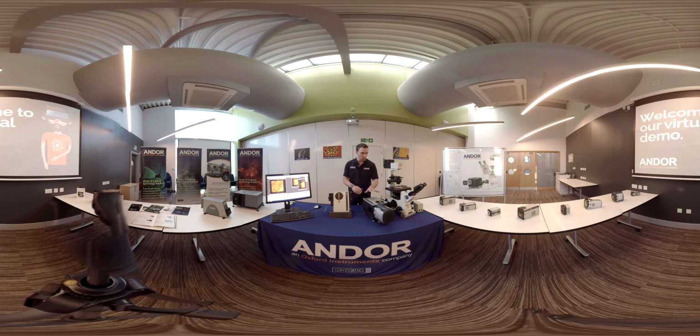When using it in microspectroscopy, you'll probably want to have a plunger operated wide aperture slit as the entrance. You can see, I'm going to run the system. You can move your sample around, find out exactly where you want to take your data, and then narrow your slit down and move to your wavelength range of interest to get your data. The SR193 has excellent imaging resolution when used in microspectroscopy by design, and so it really enables you to find where you want to take your data from very easily.